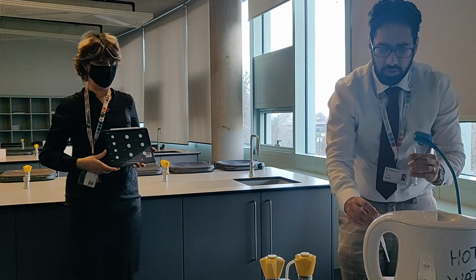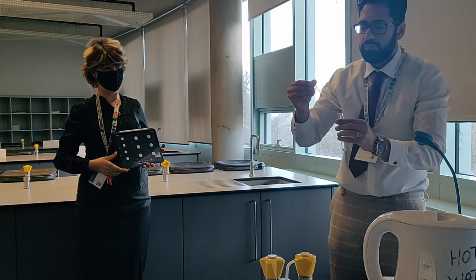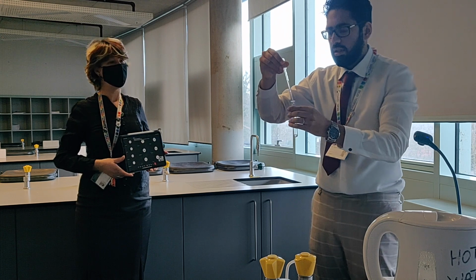Right, so sodium hydroxide solution. Okay, 10 drops. 1, 2, 3, 4, 5, 6, 7, 8, 9, 10.